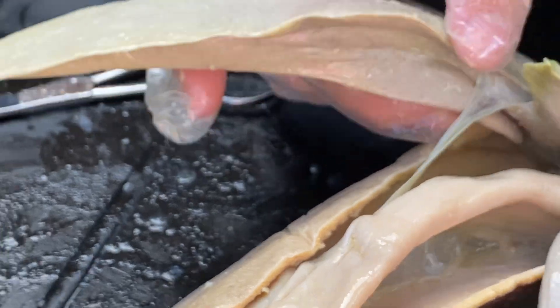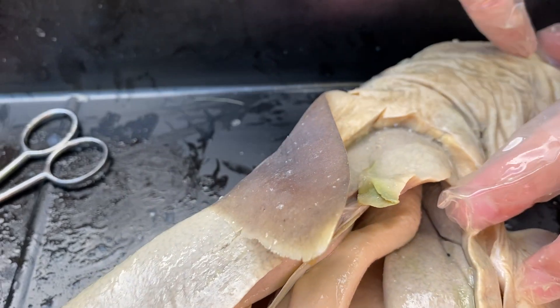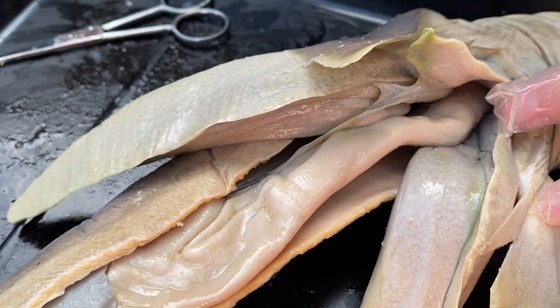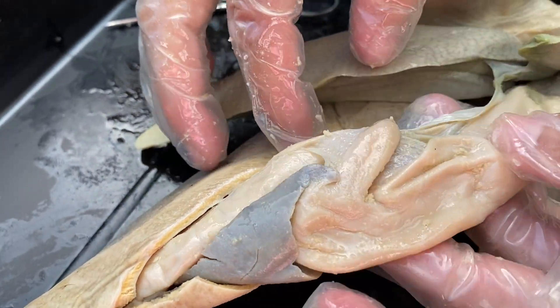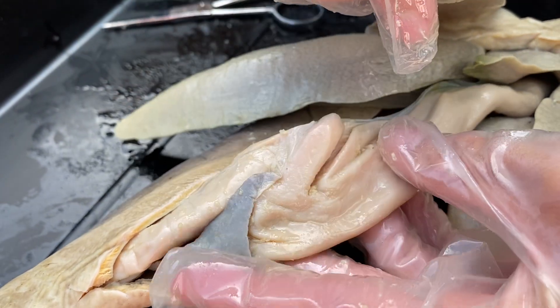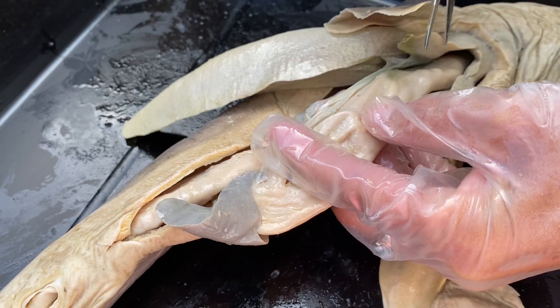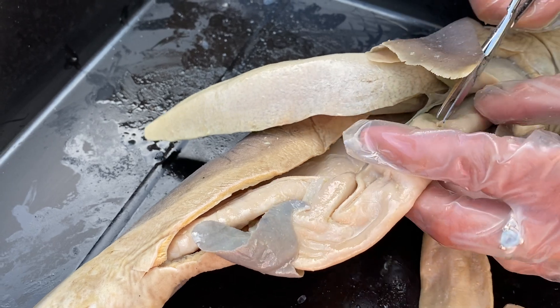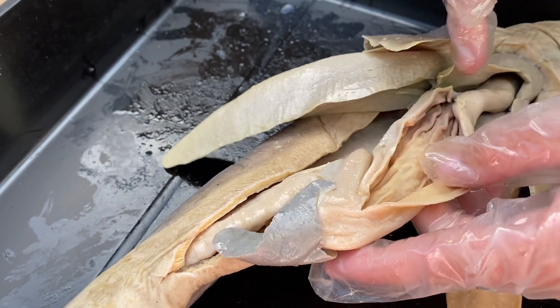So here are your large livers. Underneath your large liver is the part of the digestive system. This is your esophagus — it's a straight tube from the mouth right down here. If you think about our digestive system, it's really kind of the same track. Mouth to esophagus, just like us, esophagus leads to the stomach. This is their stomach right here. However, sometimes we get really lucky with these shark dissections and they actually have food — their last meal — inside of their stomach. It feels like that's not going to be the case for this one, especially if it's a juvenile. But let's open it up and see. I'm going to start cutting through the lining of the esophagus first, and then we'll go into the stomach, because the insides actually change — you can tell the difference of when the stomach actually starts compared to the esophagus.